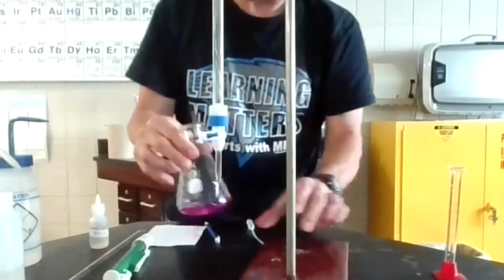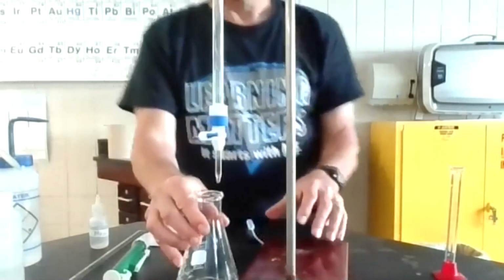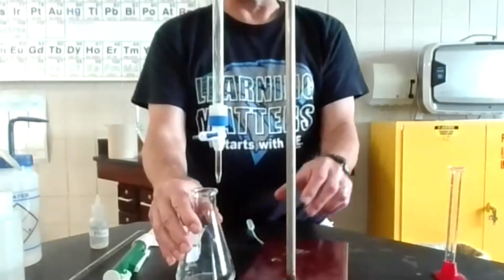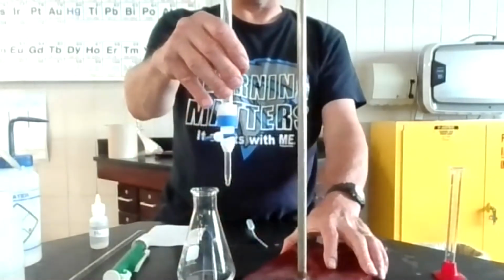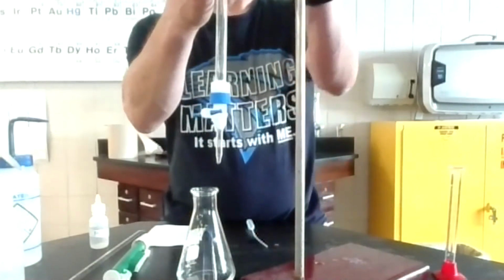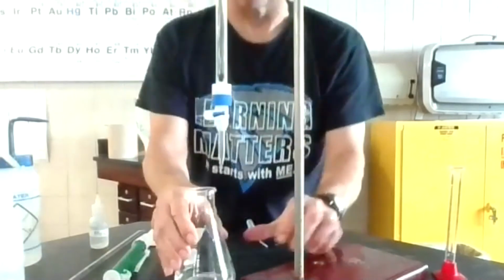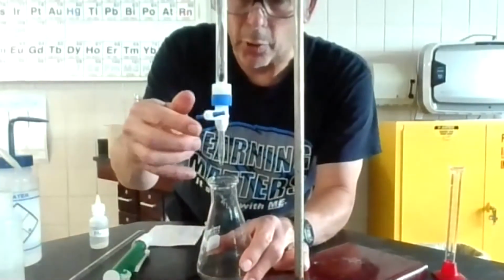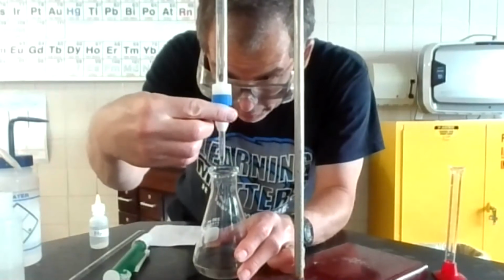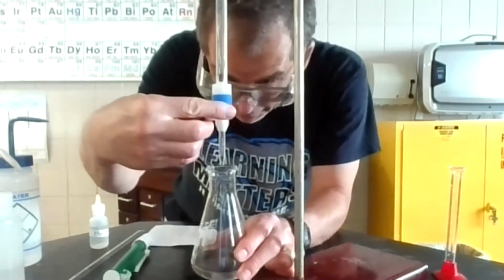So I'm really kind of gambling. I got that really, really pink, and I think I'm within a couple tenths of a milliliter of getting there. So I kind of know what to predict. So I made the solution, I did the calculation, but you won't know that, and I'm definitely within the range that I need to be. So I'm over 5, but I'm less than 15 right now. Okay, that's not a lot of hint for you, and I'd probably add 1 drop at a time.